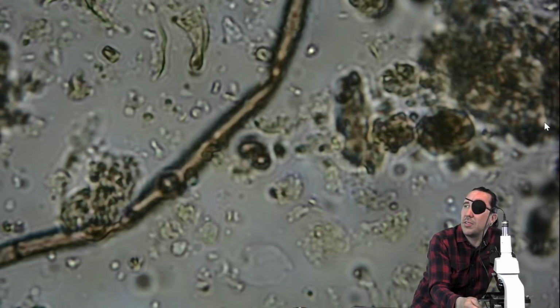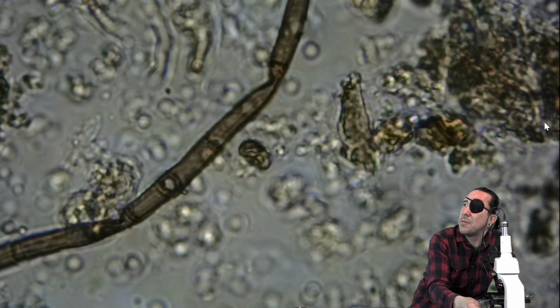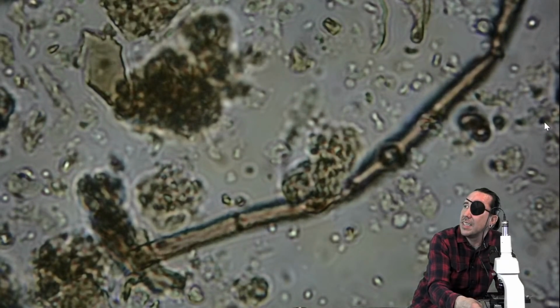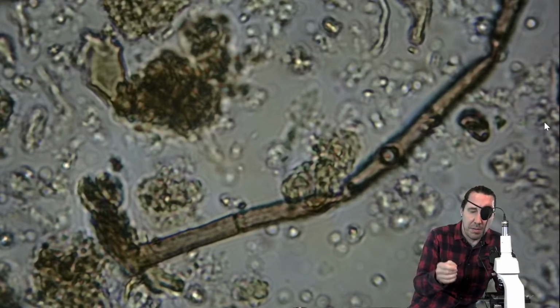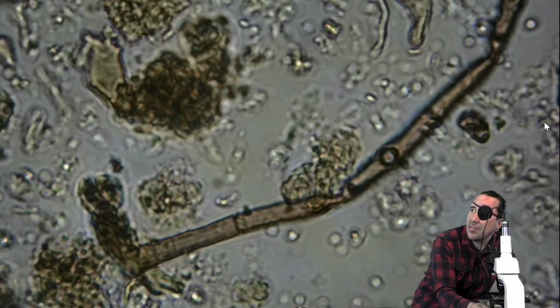It's also hard to use a camera to get things into view to show other people. All right, so I can't positively identify this as a fungi, although it does look like it has uniform diameter and septa throughout here. But it's also very scrunched, and I can't positively identify it, so I can't count that.